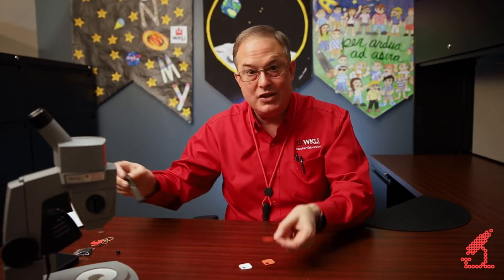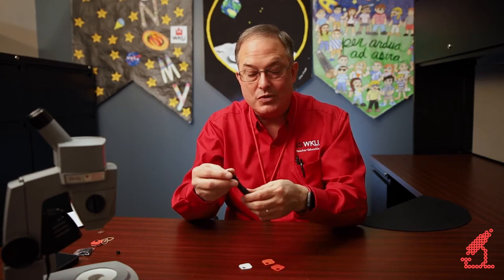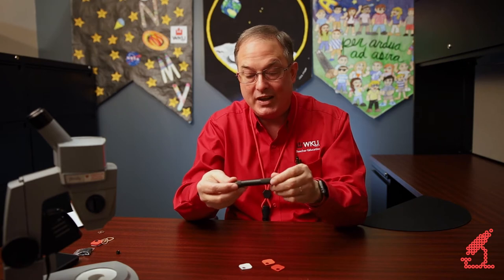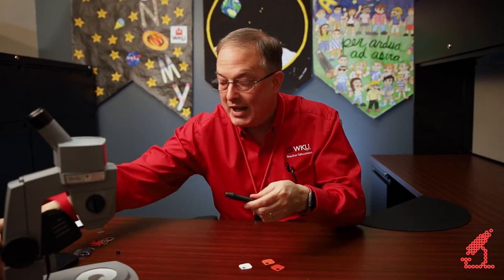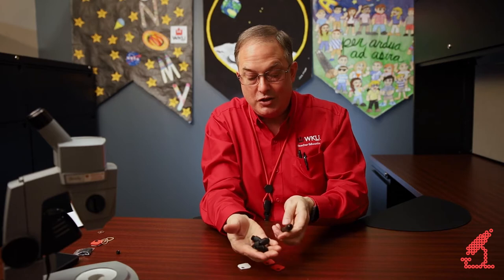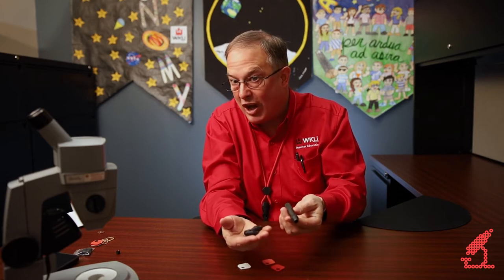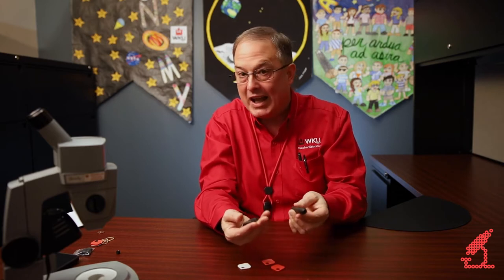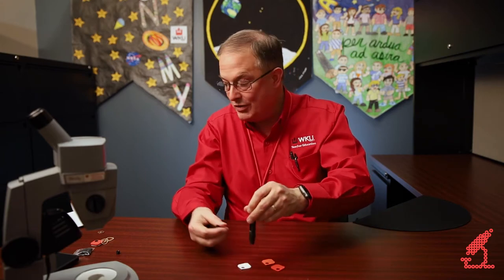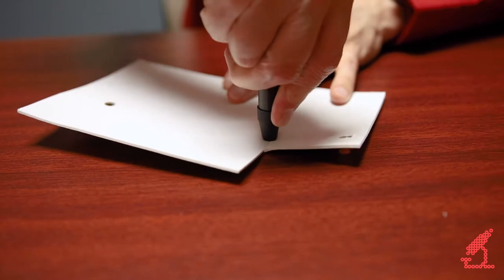If you're using your own lens or you don't have a Cricut, I recommend that you use a leather punch. You can pick up a set of these — you have different size punches. You can pick up this set for like $10 or $11 online or in a craft store, and you can literally use it to punch the right size hole.